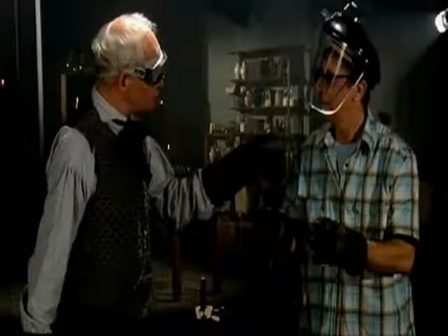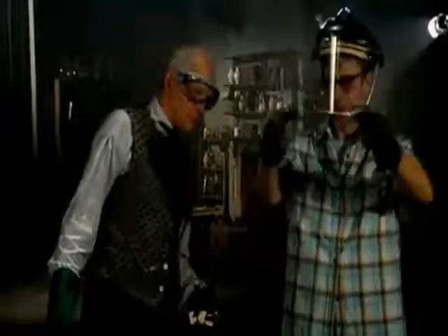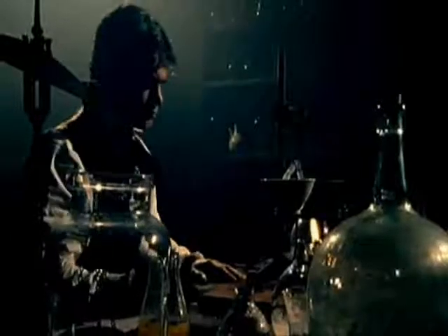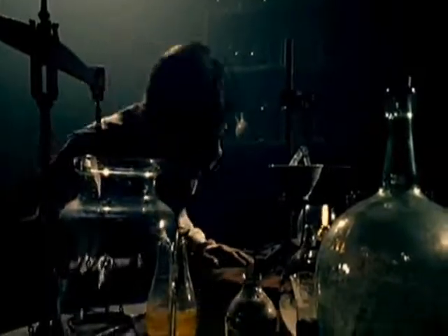And can you detect the strong smell of chlorine? I can now. Absolutely. Well, he detected the strong smell of chlorine, and this was a major mystery for him. Faraday soon realized the increased pressure inside the sealed tube had caused the gas to liquefy. And when the tube was broken, the oily liquid evaporated.